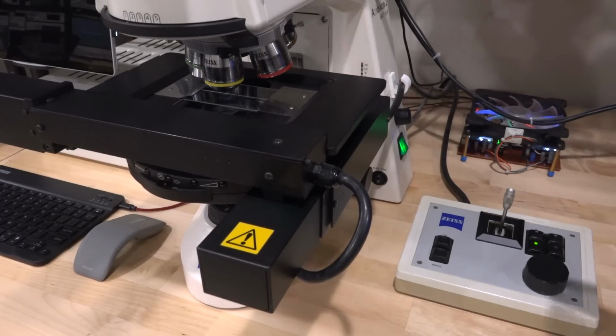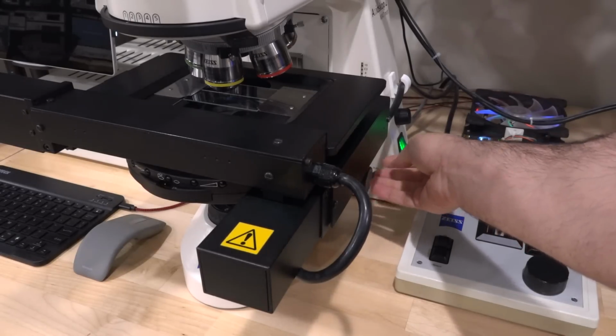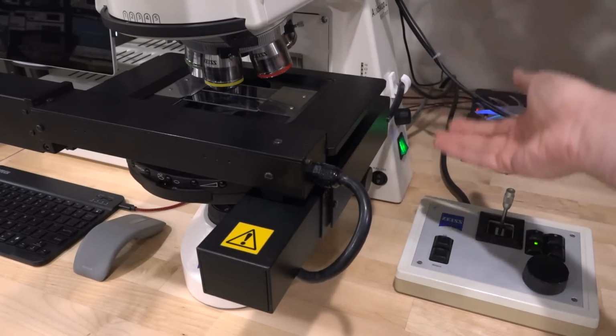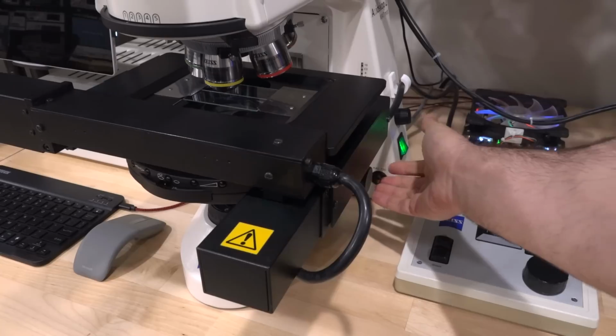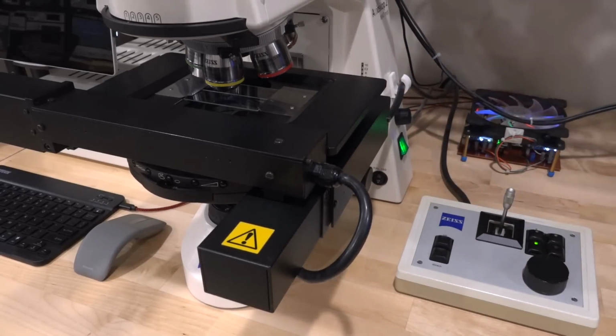And the Z movement itself is also motorized, and you can move this. So when you move this knob down here, you're actually not moving it mechanically by gear connections. You're sending encoder pulses to the controller, and the controller moves this using a servo as well. So this basically now has XYZ servos.